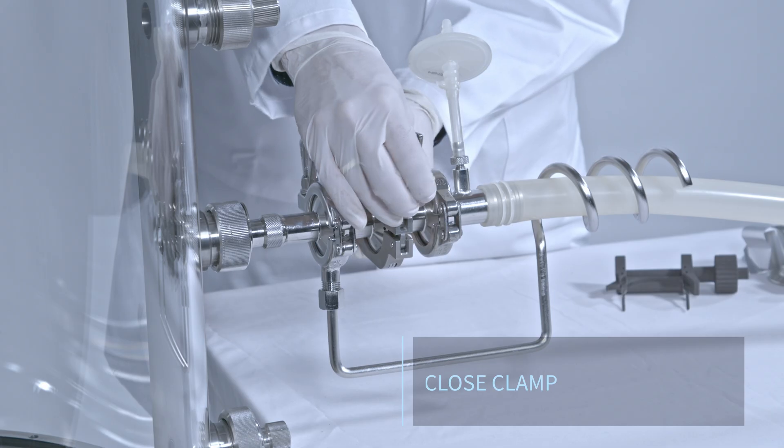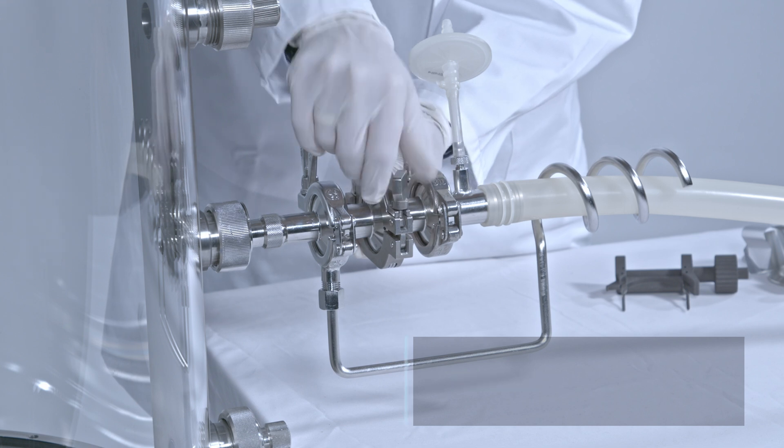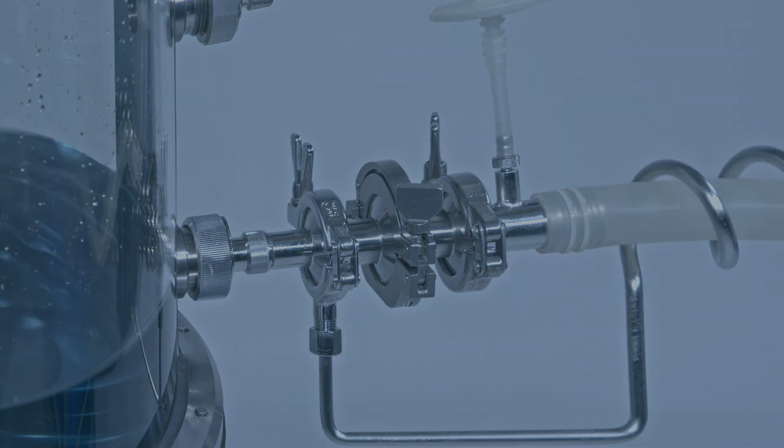Four, close the clamp. Once the clamp is closed, the system is ready for use.